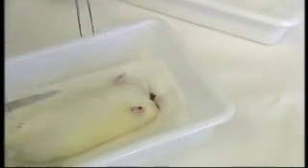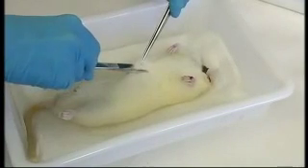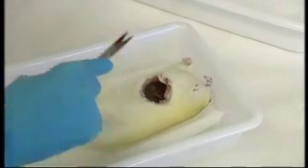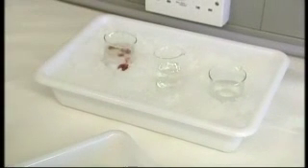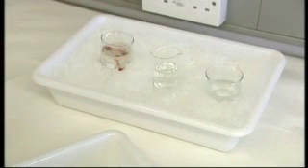Rapidly open the thorax of the decapitated rat and extract the heart. Make small incisions and then immediately transfer the heart to the ice-cold solution in the first beaker.